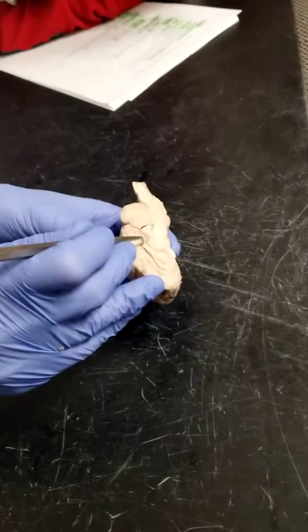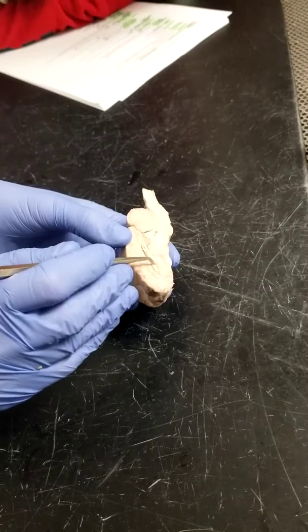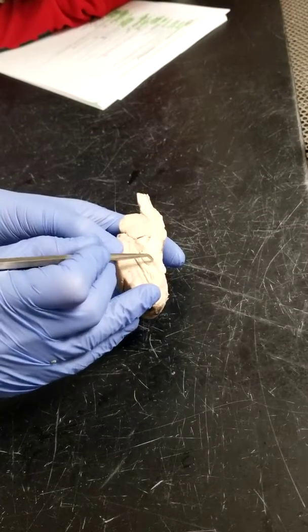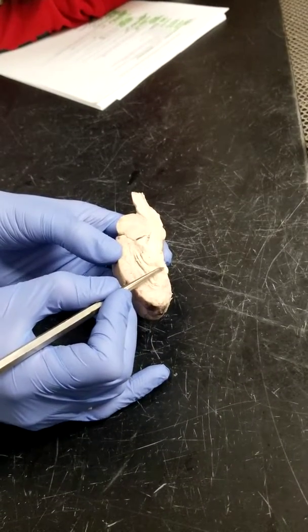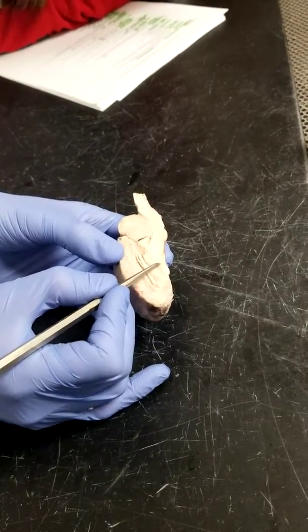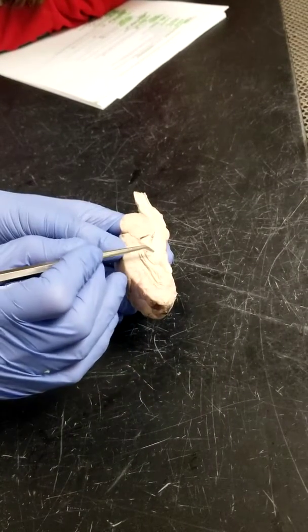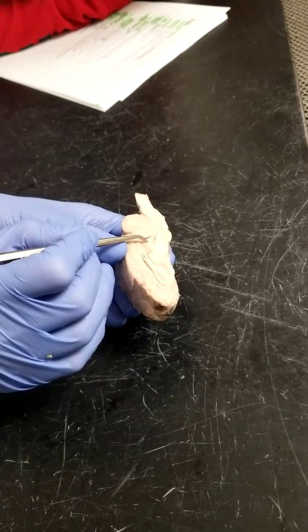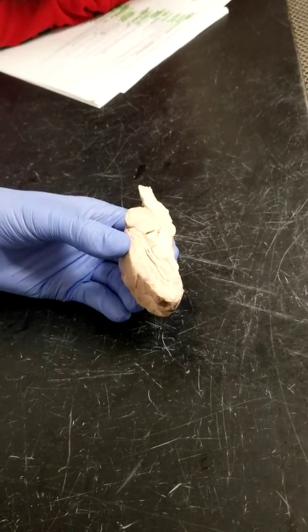Okay, so here we go. Lateral ventricle from the corpus callosum down through that interventricular foramen into the third ventricle, circling around the thalamus. Look inferior to the thalamus, you've got the hypothalamus. If we go posterior from the thalamus through that cerebral aqueduct, we're going to pass the superior colliculi and the cerebral peduncle.